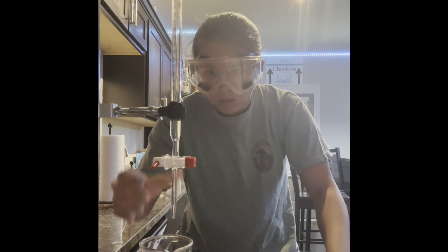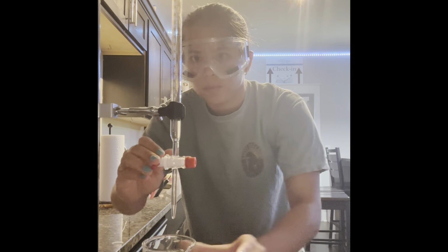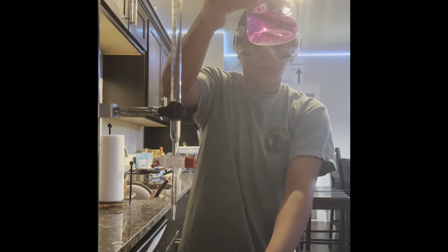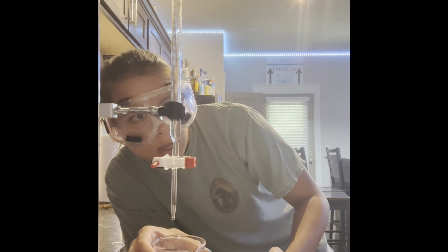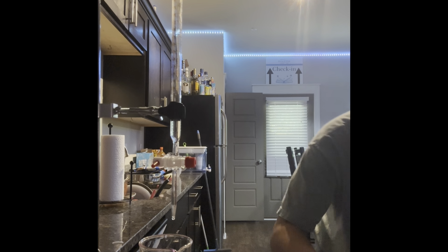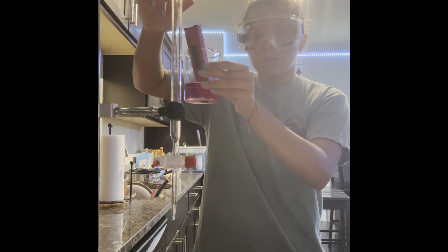Okay, so we're about at titration now, ending it. We're at 6.4. And we're there at 48.5 milliliters of added titrant at a pH of 7.5.